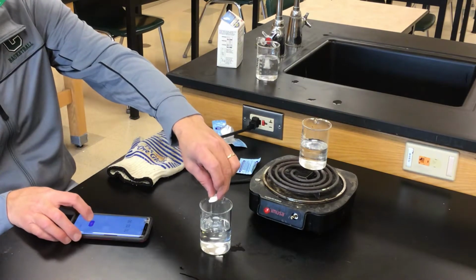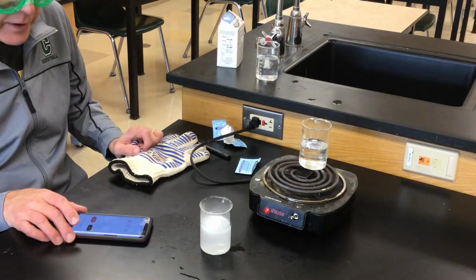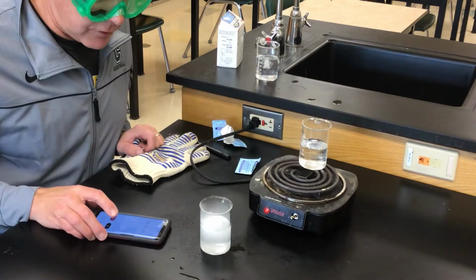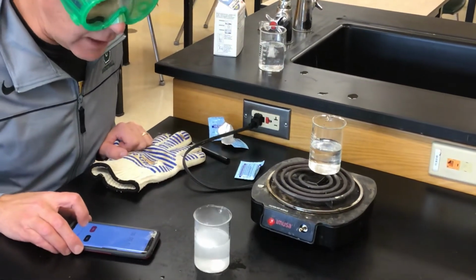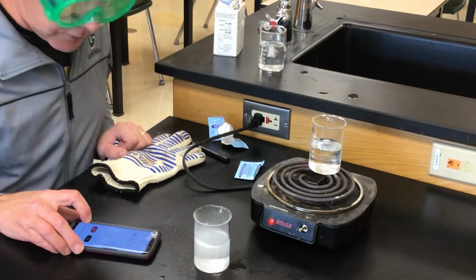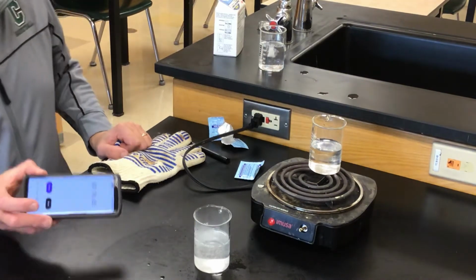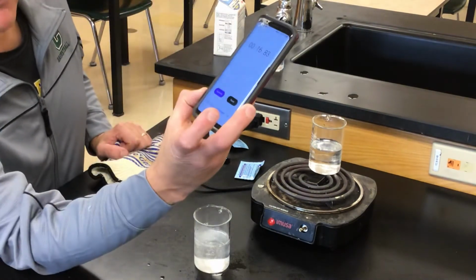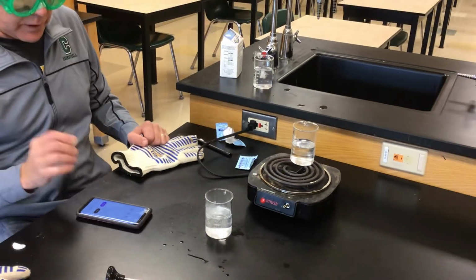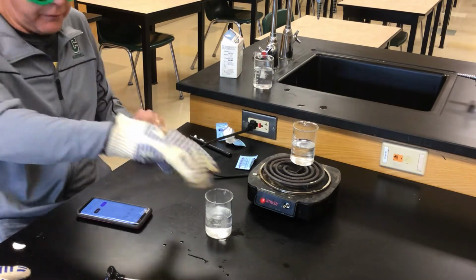I'm not gonna show you this every time. But if I drop the Alka-Seltzer in and hit start, you can just tell how much faster it looks like it's going. You really shouldn't look in the top of a reaction like this. I'm trying to estimate from the side. And it looks like it's done about now, which would be the data point I got for that one: 16.83 seconds. So at 50 degrees, it went faster than it did at 35 degrees.